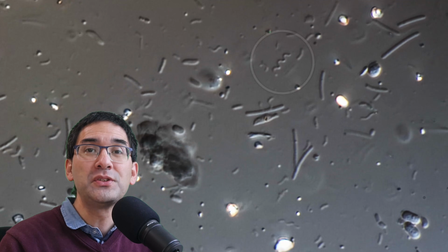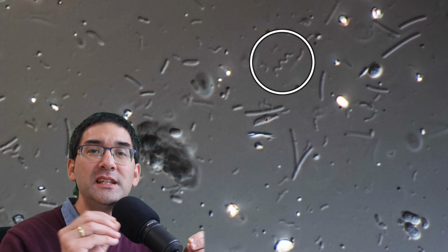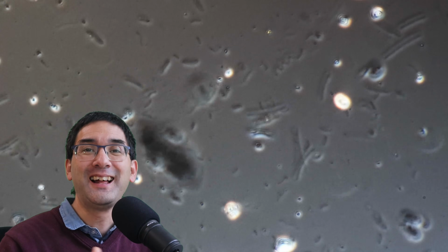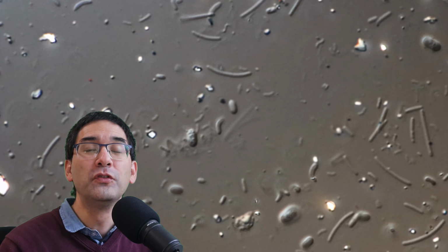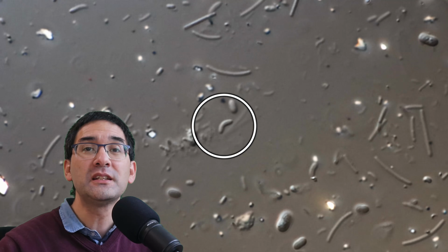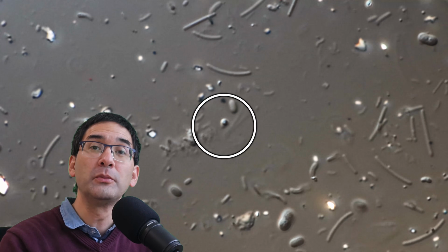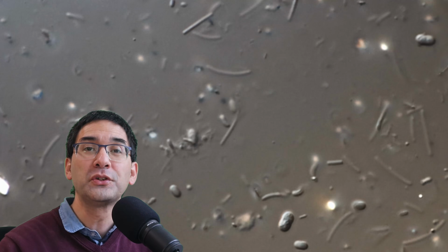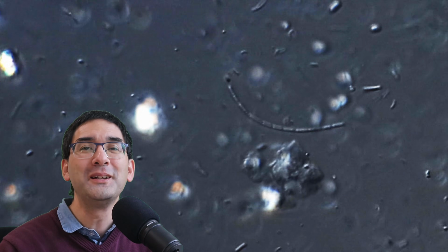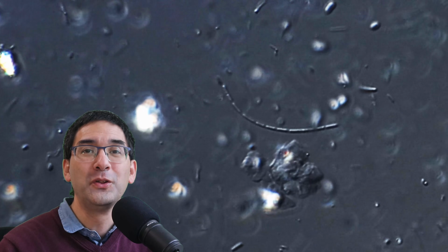But then you're also able to see that especially the smaller ones, they seem to wiggle around and to shake. And those bacteria, they move because of Brownian motion. Brownian motion is the random movement due to the thermal activity of the particles that bump into the cells and cause them to shake. But this is not movement that the bacteria make on their own.